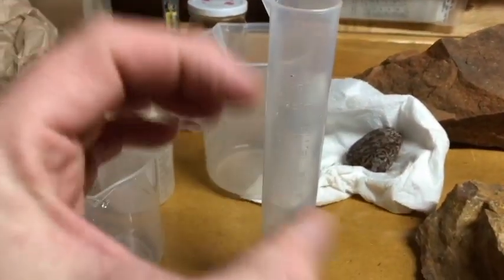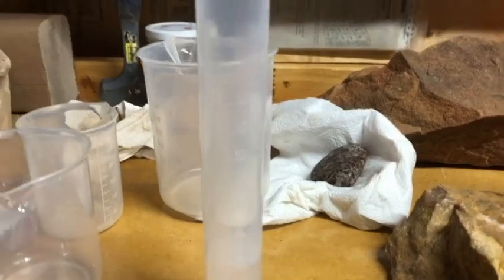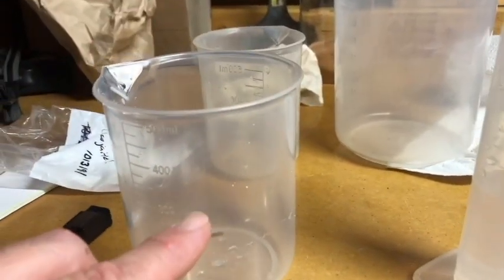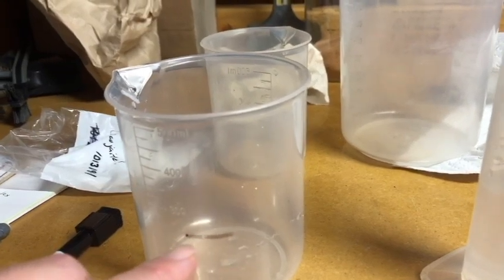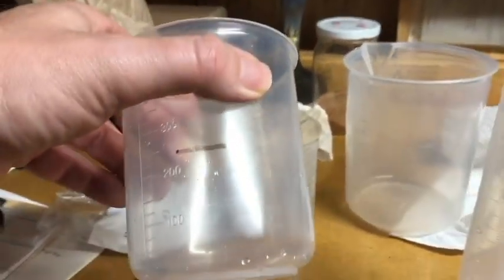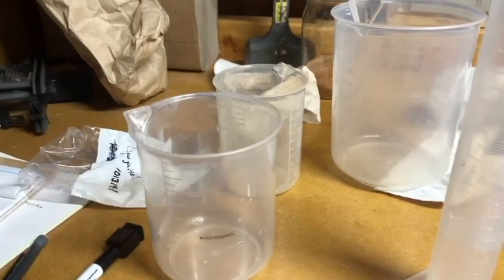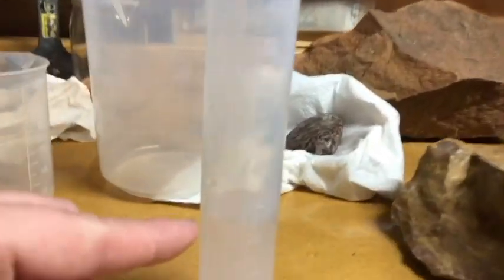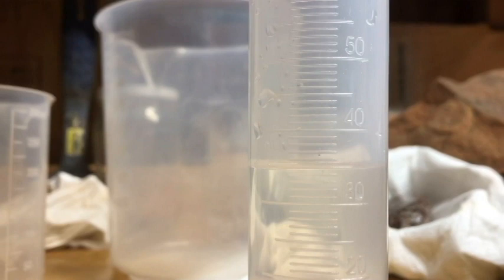Okay, so this is 100 milliliters. I've already filled and dumped it twice, so that's 200 milliliters, and this is what was left. Now, as long as I'm consistent filling it to here after I draw the line, if I draw the line on top of the meniscus, because this is a wide beaker, the top of the meniscus and the bottom of the meniscus aren't going to be any significant thickness. But when you read it on something like this, it's narrower, you want it to be from the bottom of the meniscus, and I hope this picks it up.